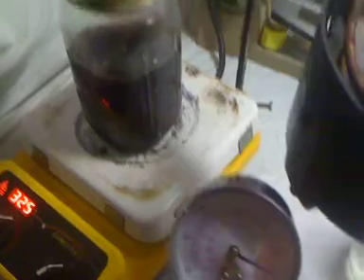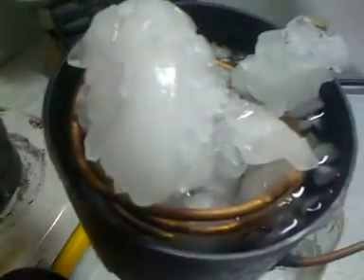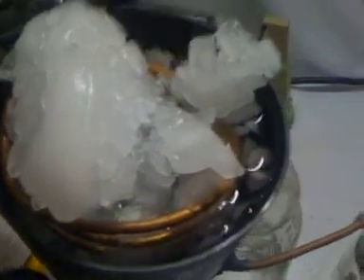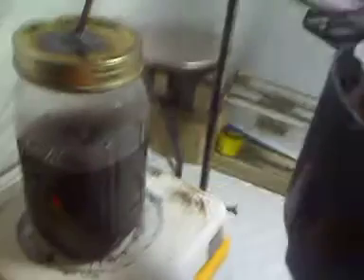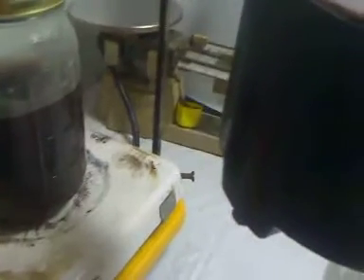I've removed our vacuum and boiling has stopped. You can see a lot of our ice has melted on our condensing coil due to the heat. We've got a good amount in our catch container, and it looks like according to the jar we've removed about 70 milliliters.